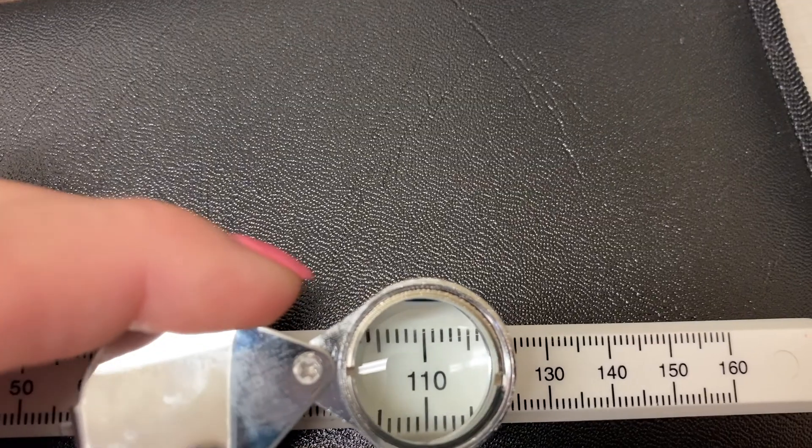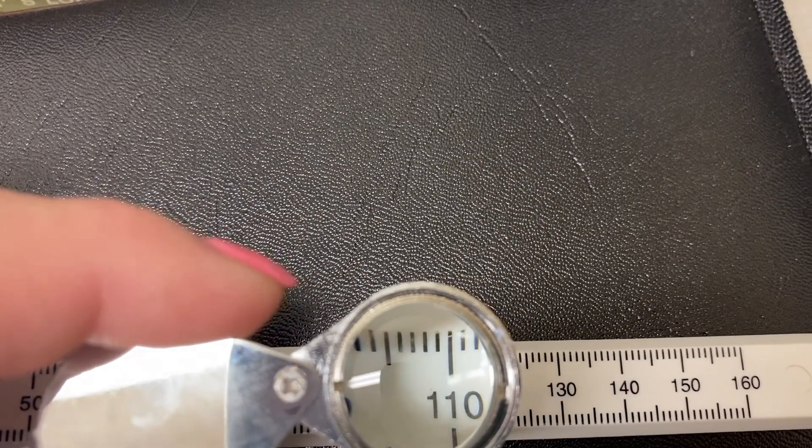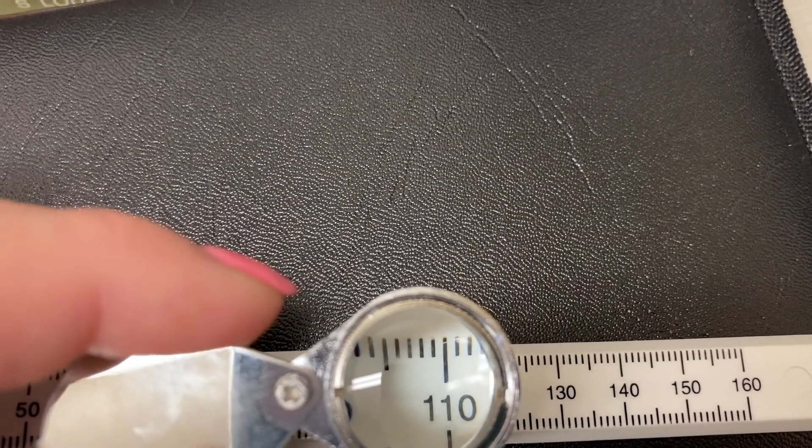We have a 10x magnification and we have a 30x magnification. So one of the things that you're going to be asked to do is to look at a ruler and to see how far you can see with the 10x versus the 30x magnification. So just kind of be aware that you will be using this in your labs a couple of times throughout the semester.